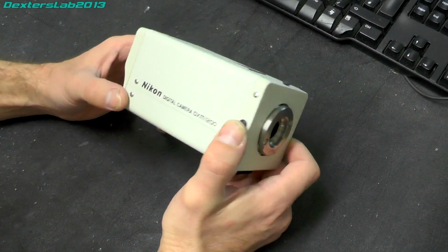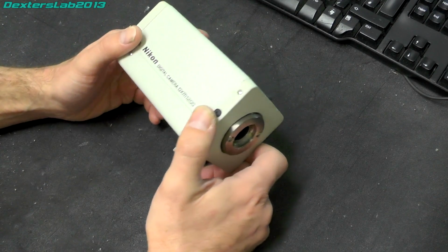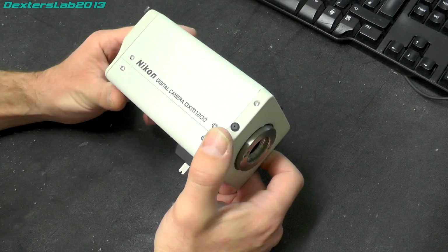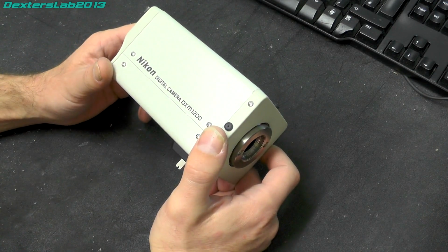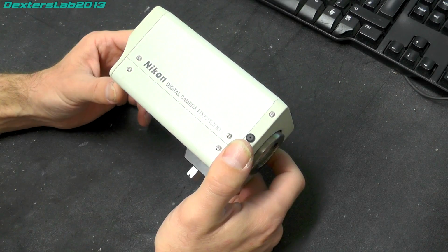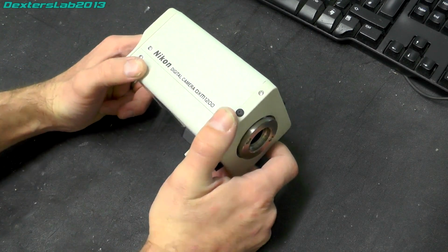Other features include automatic sequential shooting at intervals from 1 second to approximately 100 hours, 14 easy to select resolution settings from 3840 by 3072 to 640 by 480, 10 fine modes for ultra high resolution, 4 quick modes with a suggested retail price of $6,900. There we are, there's the price.